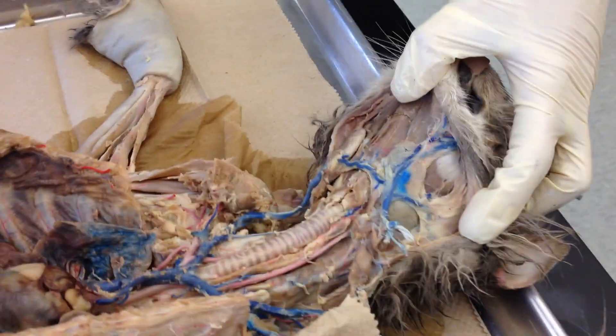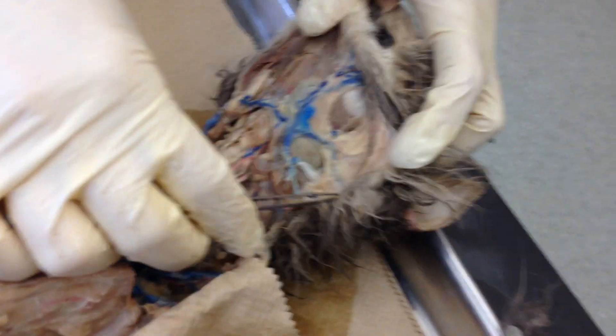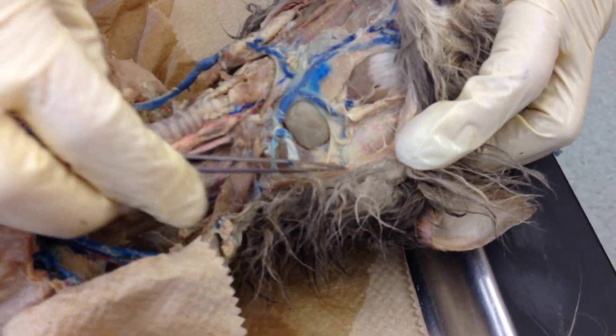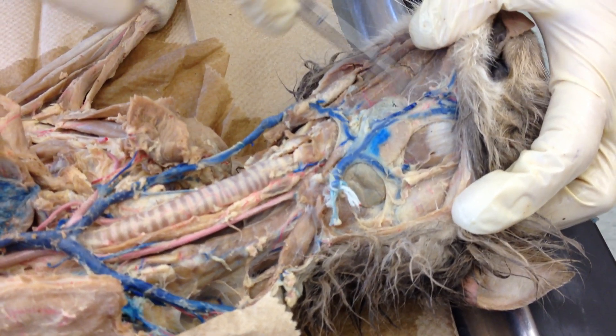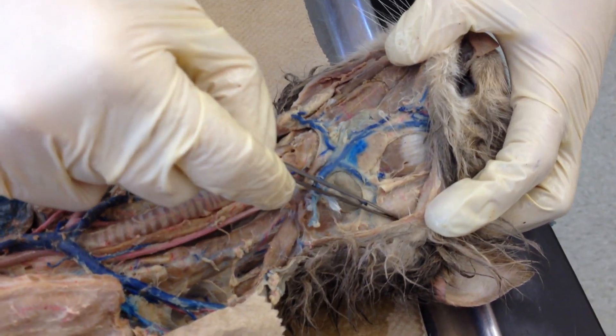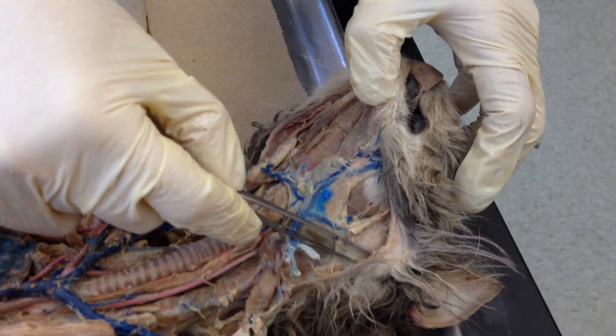We're going to do mostly vessels on this cat, but I'll hit some organs as we go along. So we can see the glands on this cat. If you look in the neck region, right here under the ear, this large gland is the parotid gland. Right here is the submandibular gland, just along the jawline. You can't see the sublingual glands — they're going to be inside the mouth under the tongue.